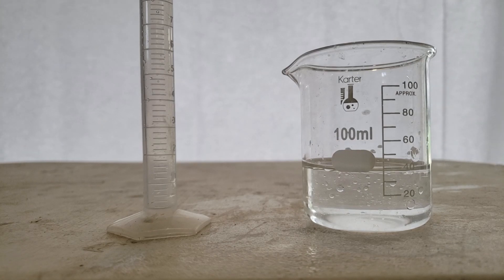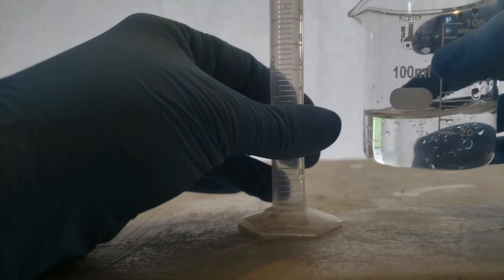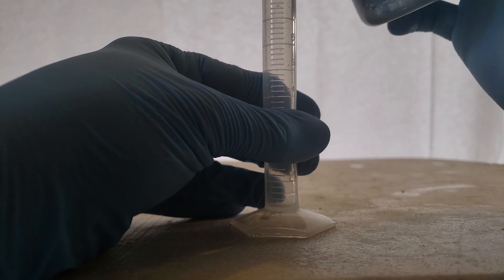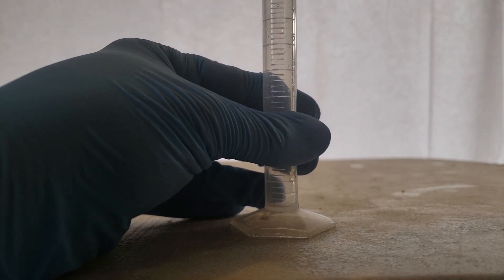I transferred the liquid into a graduated cylinder and used a pipette to extract the top layer, which is our limonene.